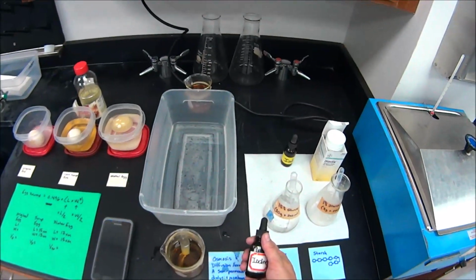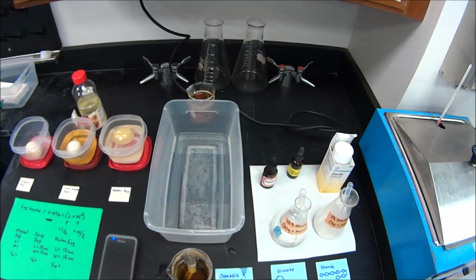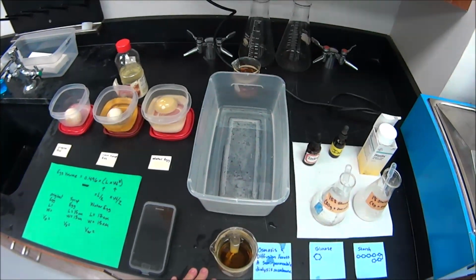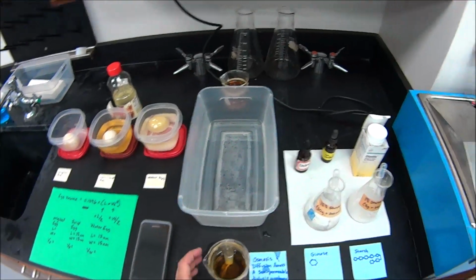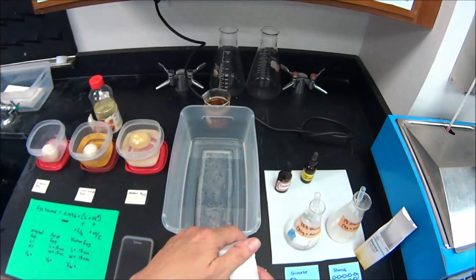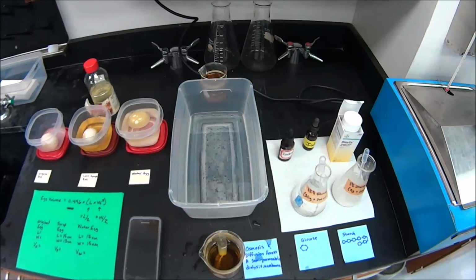Okay, another principle. Iodine will react in the presence of starch and turn it bluish or blackish. So, that is how we're going to determine, does starch cross the membrane? Because if we put iodine in the beaker water, then that water would turn bluish or blackish. Okay, now how are we going to know if glucose leaves the bag? Well, we have glucose test strips, and then we're going to swish that test strip in the water and see if glucose left the membrane. All right, but set your timers for 30 minutes and then we'll wait.